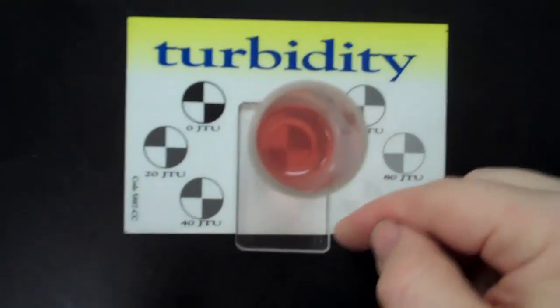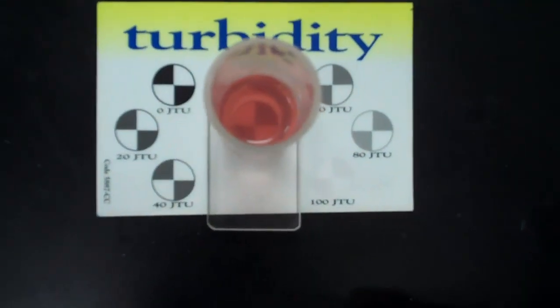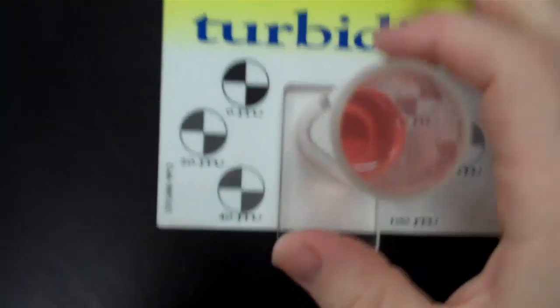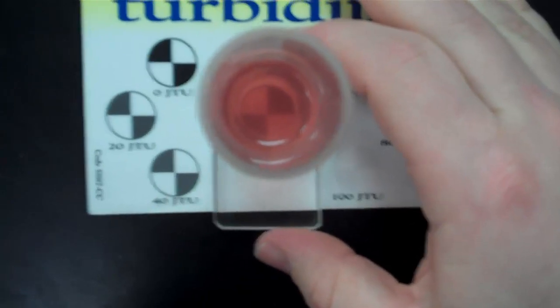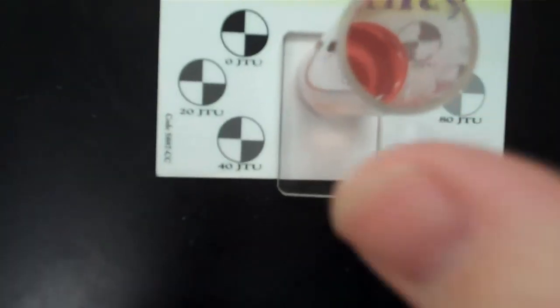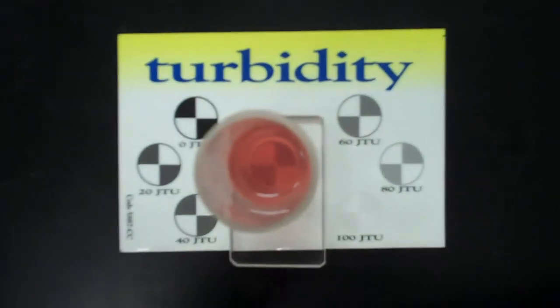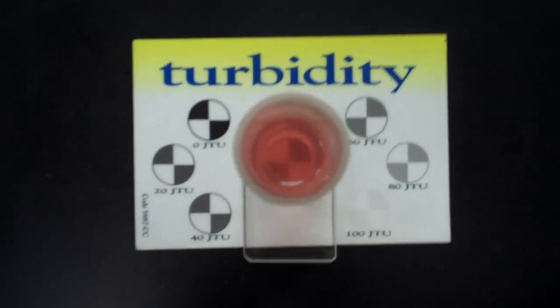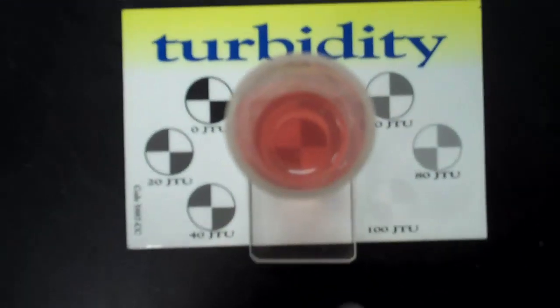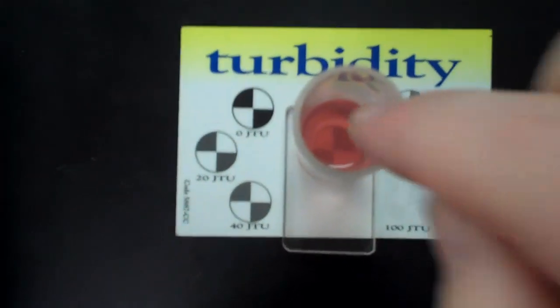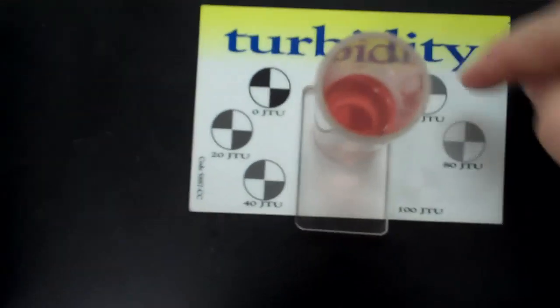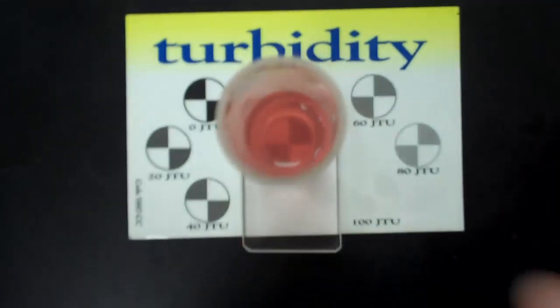You're going to line up that gray rectangle with the base of the graduated beaker. There is a circle inside underneath it, and you want that circle to be right on the bottom of your graduated beaker. Then you compare the grayness of the circle underneath with these circles around it on the outside.